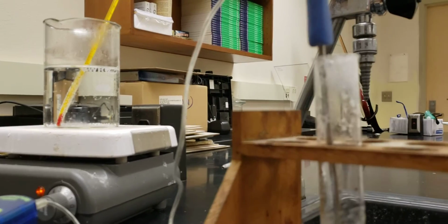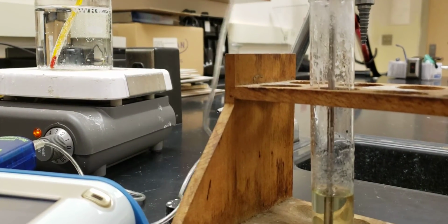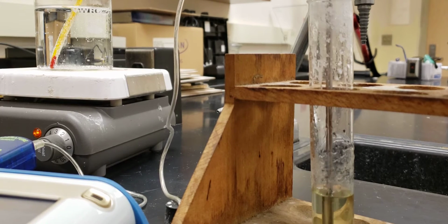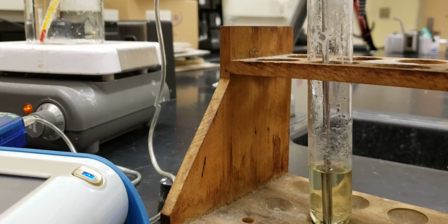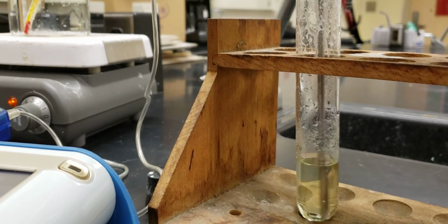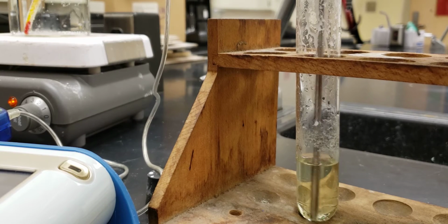And notice that we have this in here. Let's go ahead and tilt this down. Now, as this is cooling, what's going to happen is that you're going to keep moving the thermometer in here so that the thermometer does not get stuck too early. And the thermometer is still recording the temperature.